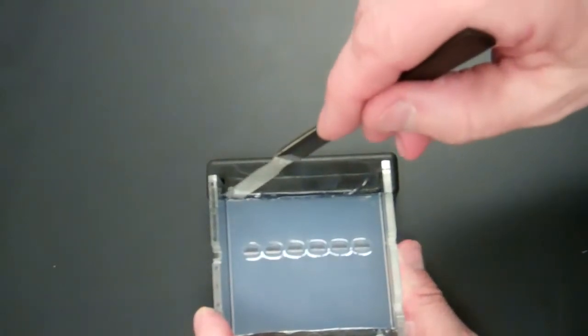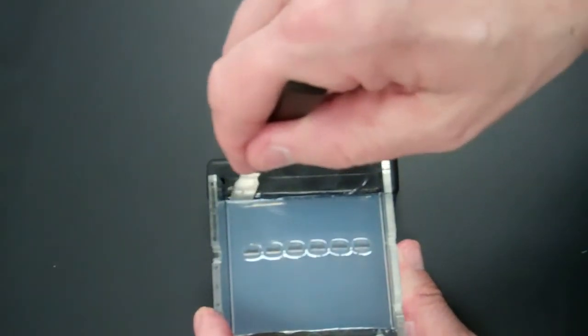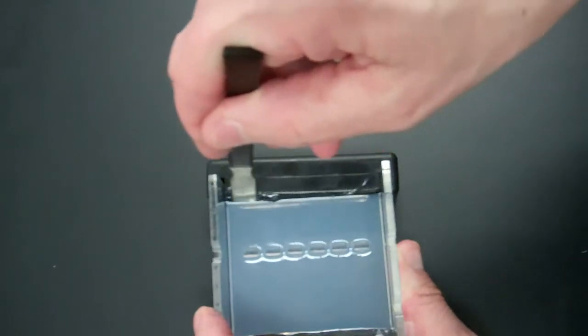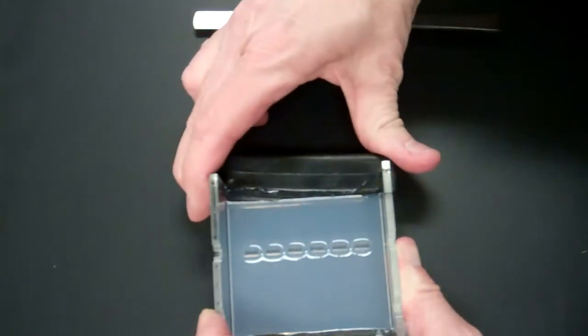And this one seems like it's pulling the gel a little bit. So if I put the spatula in and get a little air pocket going, there we go.